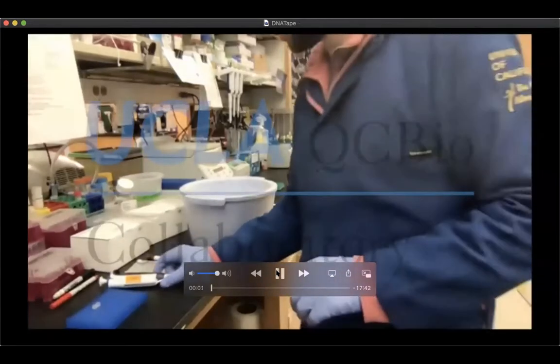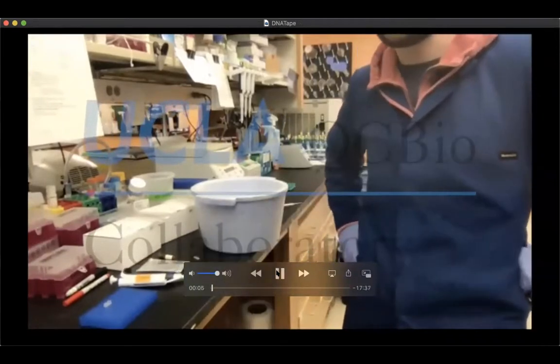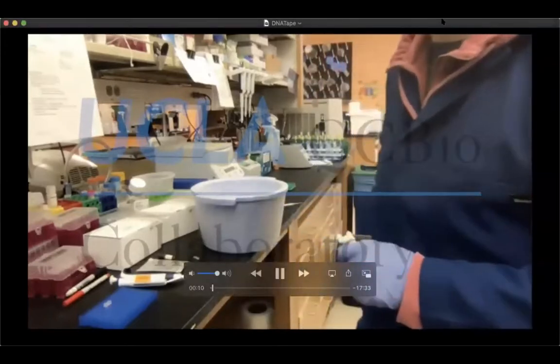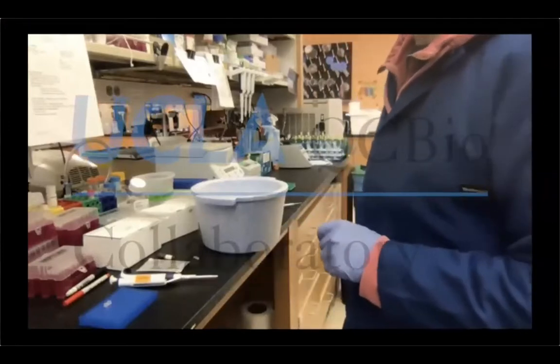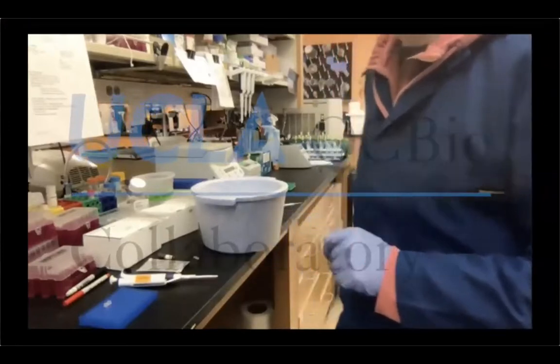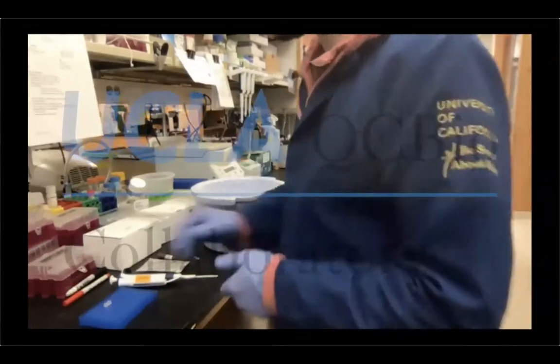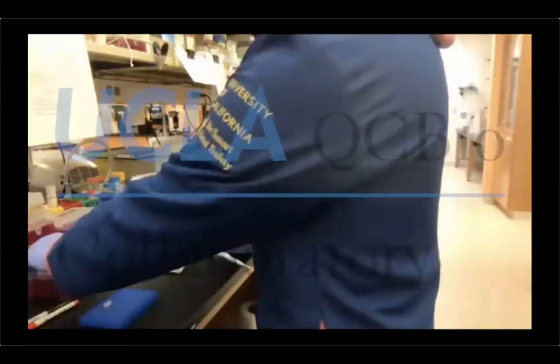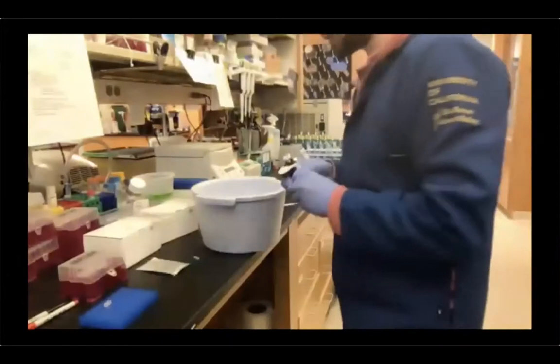Okay, so now we're gonna use the TapeStation to visualize our final libraries. Okay, so the two libraries, awesome. Remember, one of them was prepared according to the standard protocol. The other one was artificially pushed to contain adapter dimers. Let's see if we did a good or bad job of retaining the adapter dimers, which I remind you is a very bad contaminant. So what we're gonna do right now is use the D1000 ScreenTape, regular sensitivity.